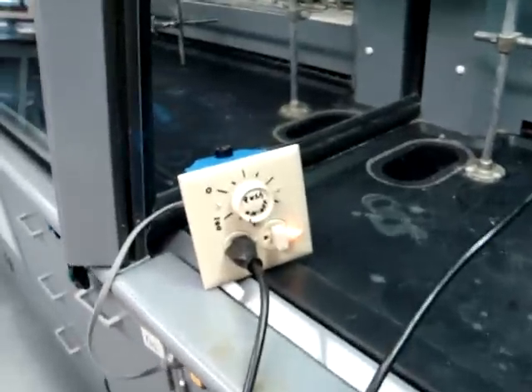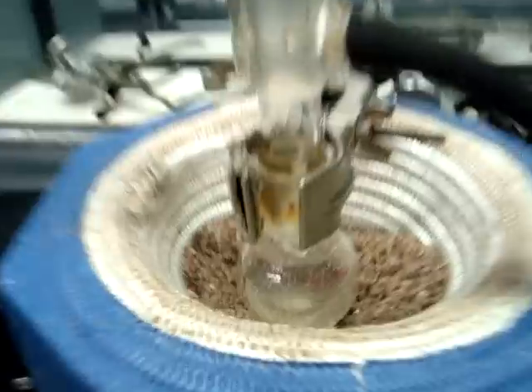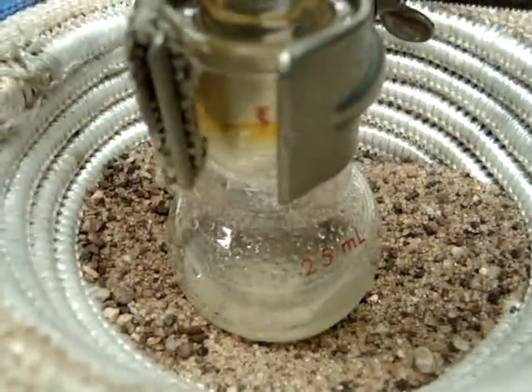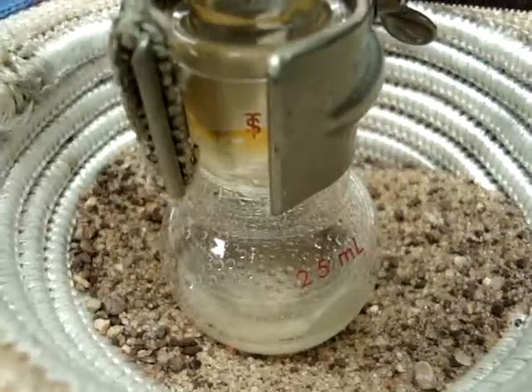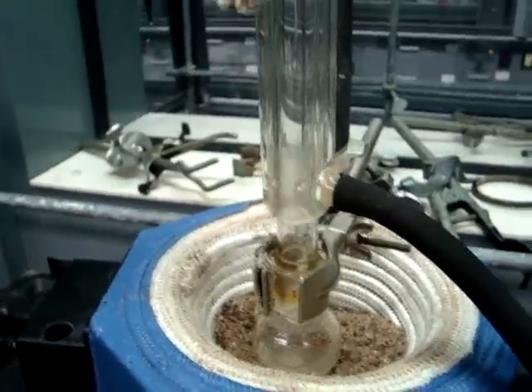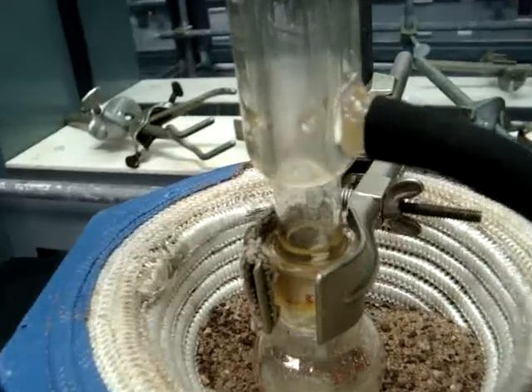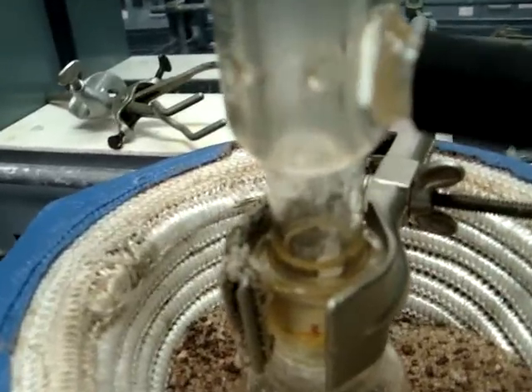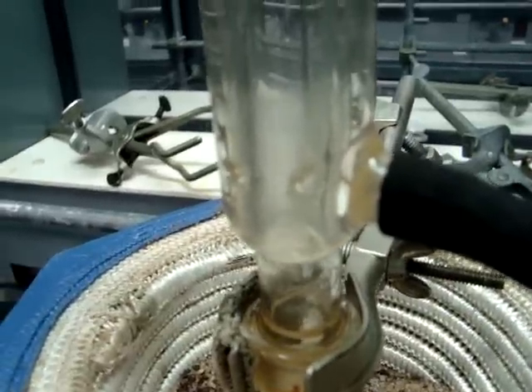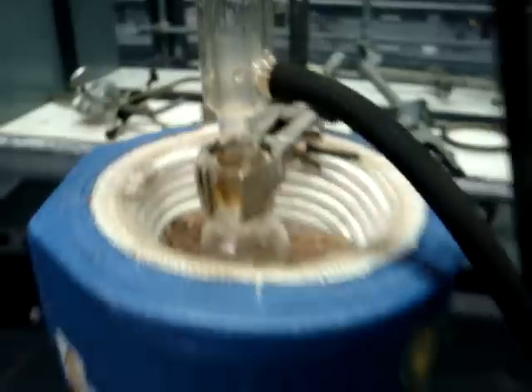You will want to turn on your heat slowly, the same as you have done in past experience when you reflux. You will have the heat on at moderate temperature, and when it starts to reflux, you will have to turn it down a little bit. Also, make sure that you are turning on the water and have a steady stream going throughout the condenser while you are refluxing. Make sure the condenser is clamped together and the heating mantle is on a ring clamp.